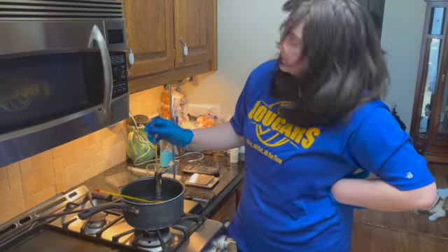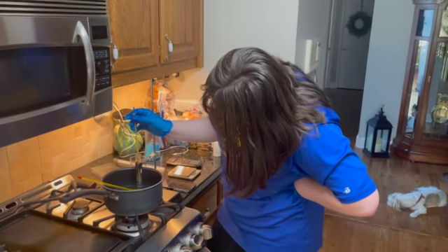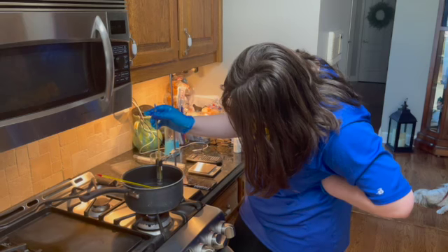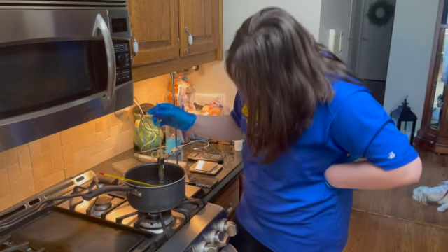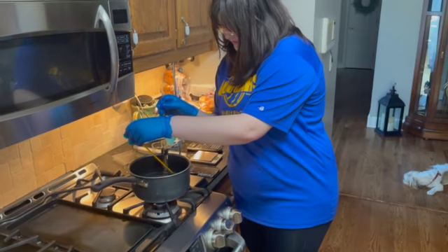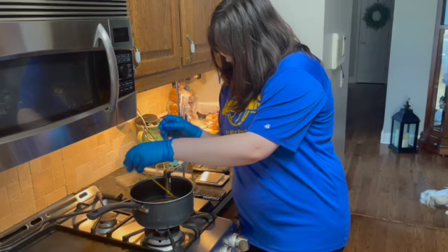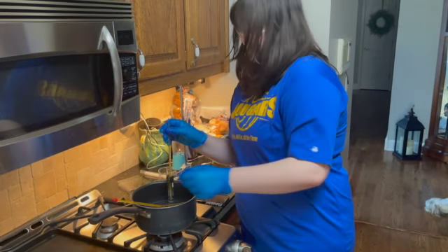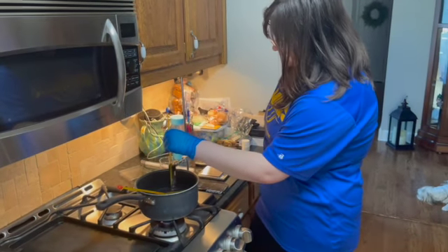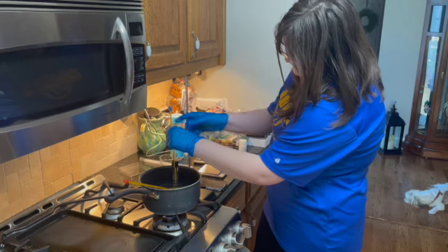Okay, so we're at the 16-minute mark of this, and our solvent is at 54 degrees Celsius, and it's getting close to 55 actually, and our hot bath is at 55 still on the dot. And now there's just a little bit of it left in there.